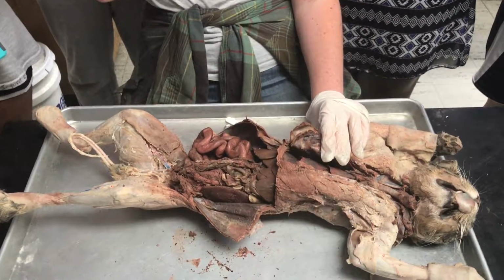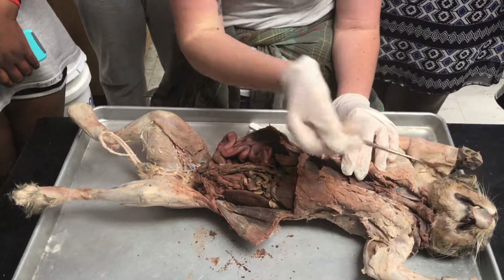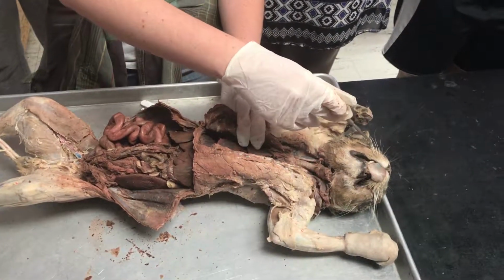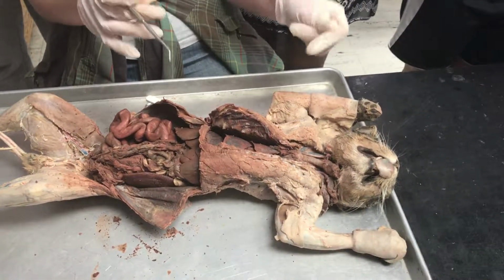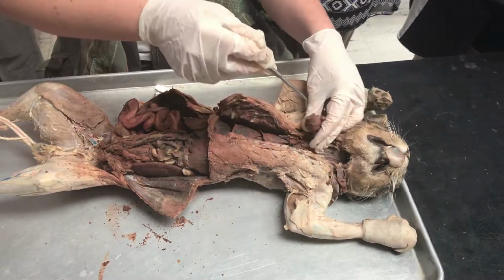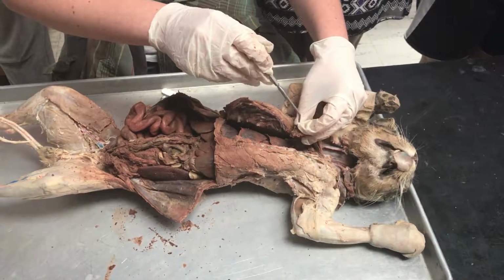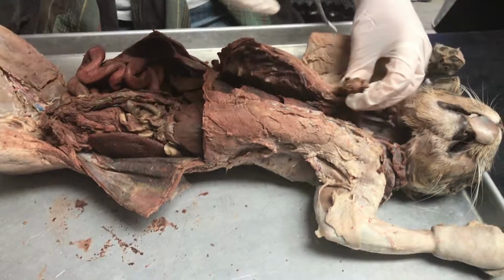Okay? So going through respiration, respiration starts when air comes in through the external nares, and it goes into the nasal cavity. From there, it's going to go into the pharynx, which I told you is a common opening for both digestion and respiration, but that's where it's going to diverge. From there, air is going to pass through the glottis of the larynx and into the trachea.